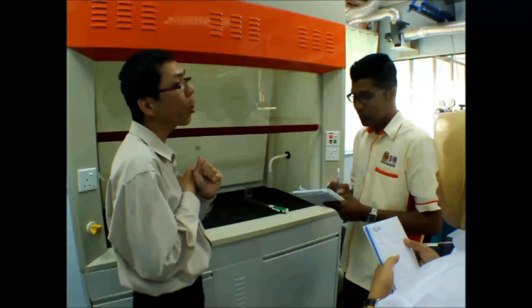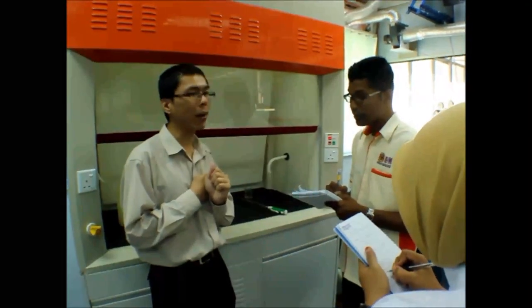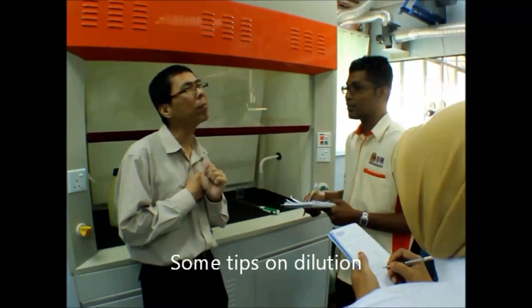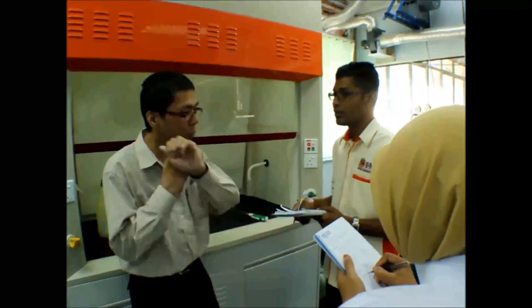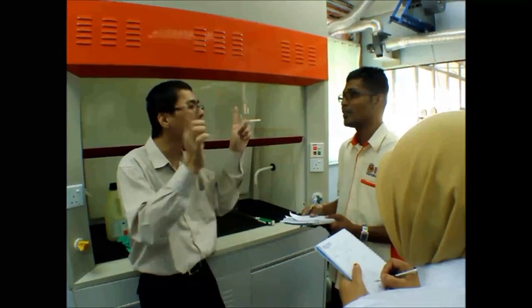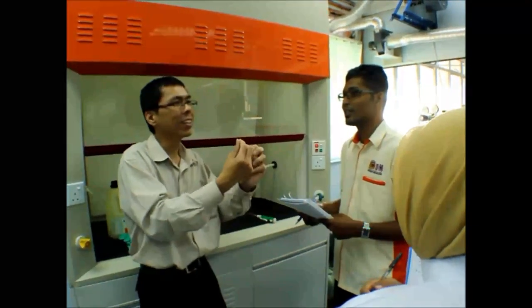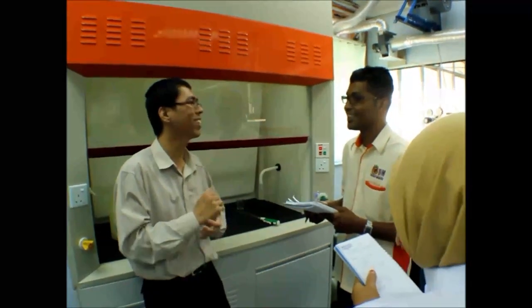You prepare copper first. So our standard is 1000. You cannot directly dilute to 2 ppm normally. So you need to dilute to 50 or 100 first. Then after that, from there you dilute maybe 10 or 5, then dilute again. Leceh lah, but safe lah, safety.